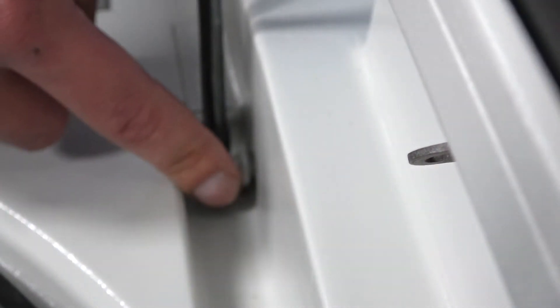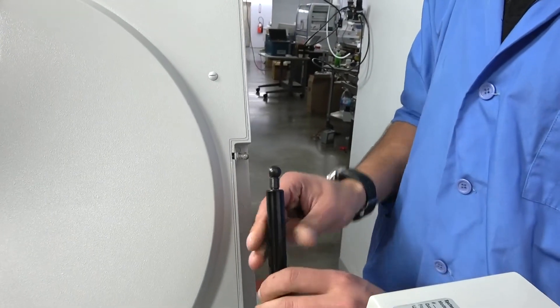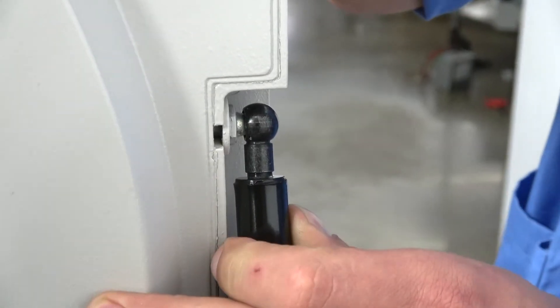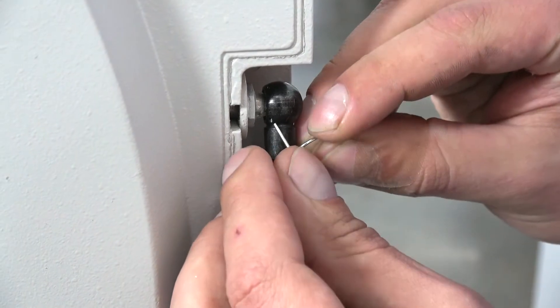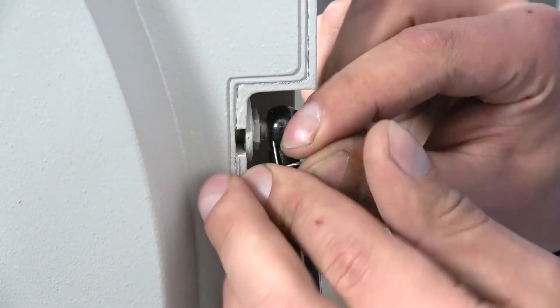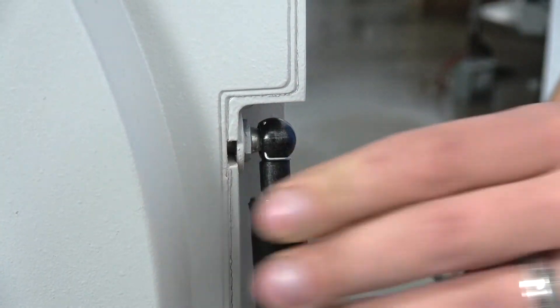Sometimes you got to work with the angle a little bit. Once it's all the way down, you snap it over and it'll come up to the top. You might need to turn your spring around and you snap it right on top. Again, you will find your hole, slide it up there and snap it in place.